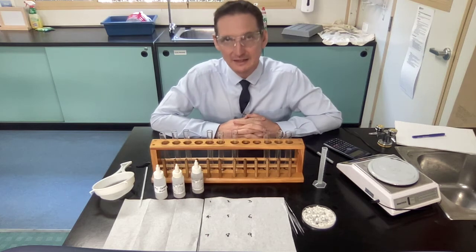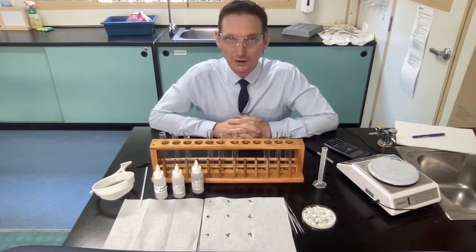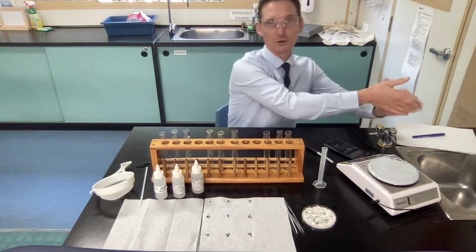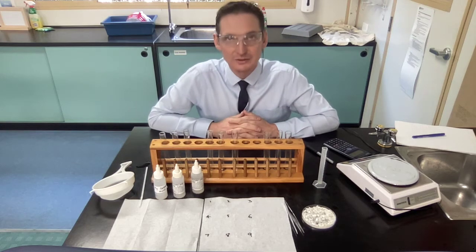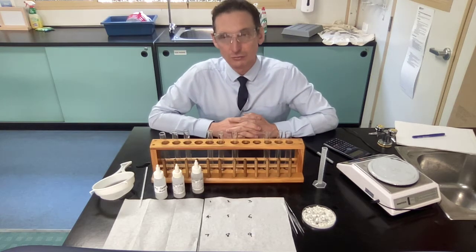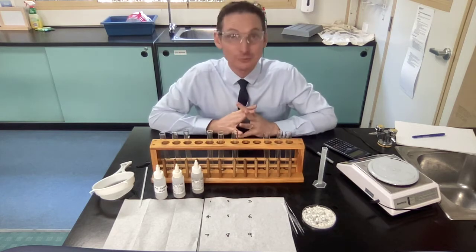If you do happen to get any of these acids, any chemicals on your skin, then you go straight away and wash them off. These are not highly concentrated acids, these are low concentration acids, so all you need to do if you get a little bit on your skin is go and wash them off under water for about 10 seconds and then dry your hands, and then you are ready to continue. Again, put your hand up for Mr. Rose and myself if there's any concerns with that. If you have really sensitive skin, then you might need some gloves. They will be available, but for the majority of people will not need that. All right, let's go. Let's weather some rocks.